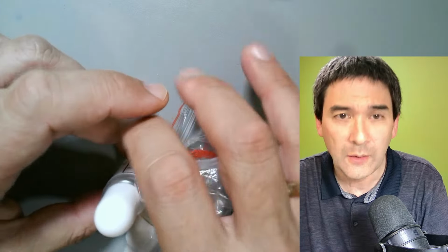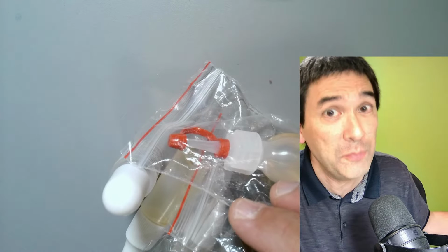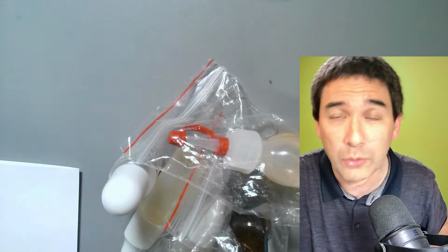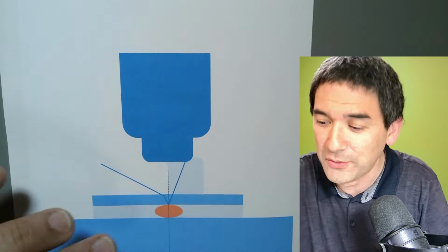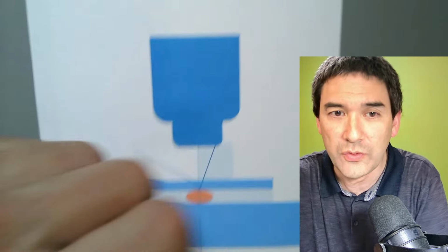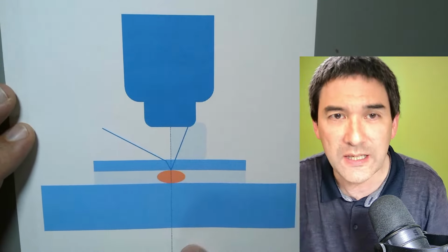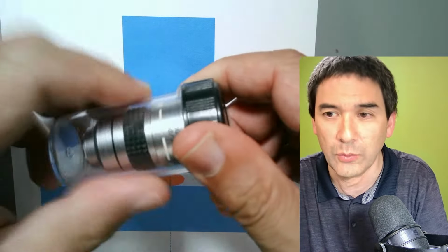And I would like to start out with a little bit of theory. You've got to bear with me, okay? But I did prepare a little diagram so that you understand what the whole topic today is about and what oil immersion microscopy is. So for a couple of minutes, I have to explain this to you. Let me rearrange the camera a little bit. What I have over here is a schematic diagram. This here is the objective. It's the oil immersion objective, like the one over here.